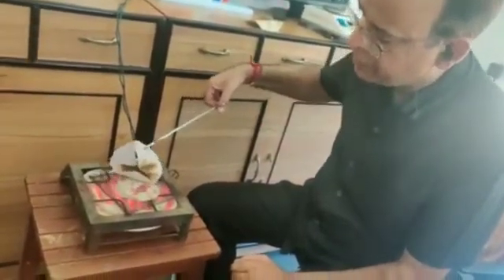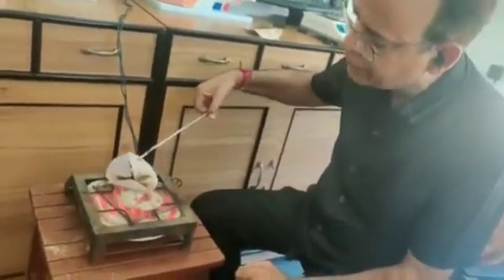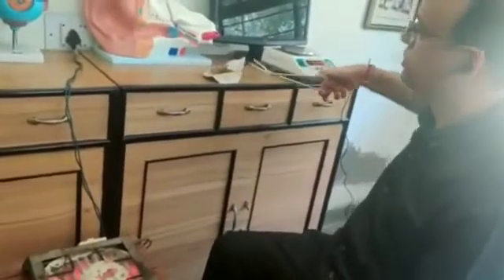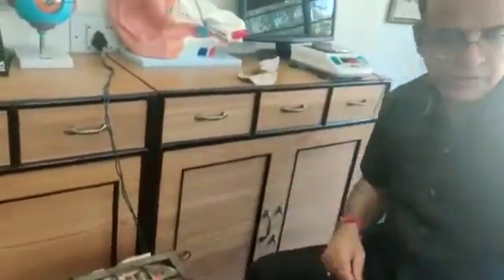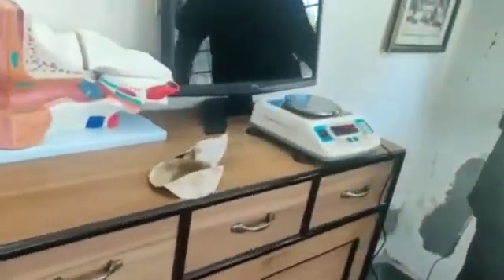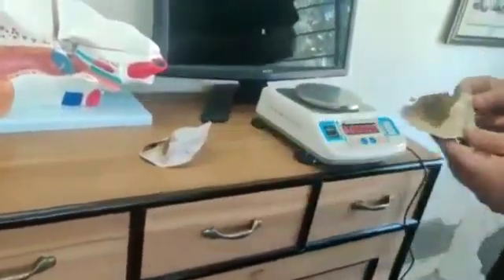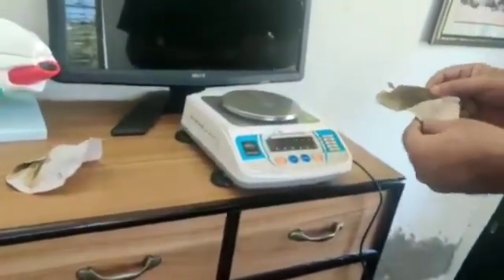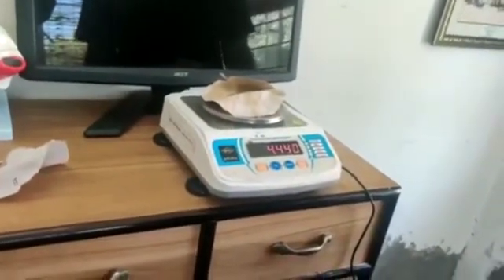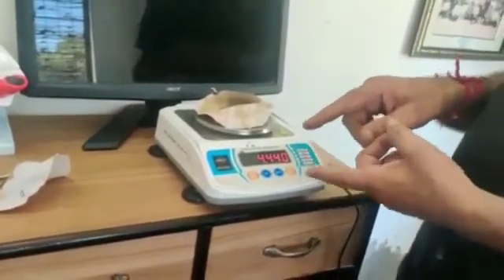You know the initial weight of both A and B. Now you have to take the final weight of these A and B — just switch off the heater and again take the weight. Filter paper A — you can note it down — its weight is 4.440 grams. From this weight you have to minus its initial weight.